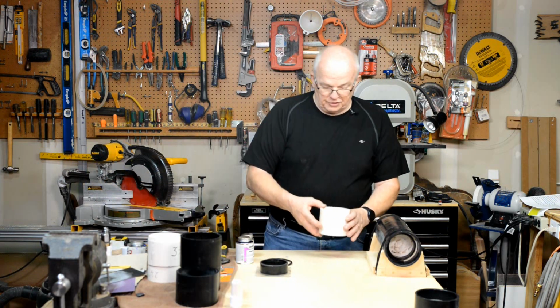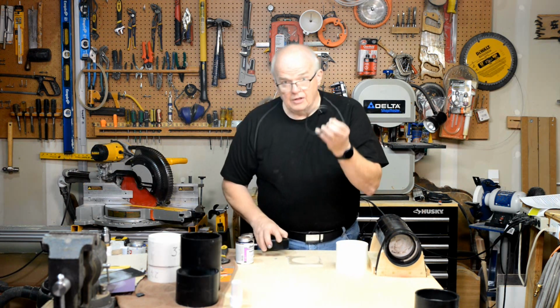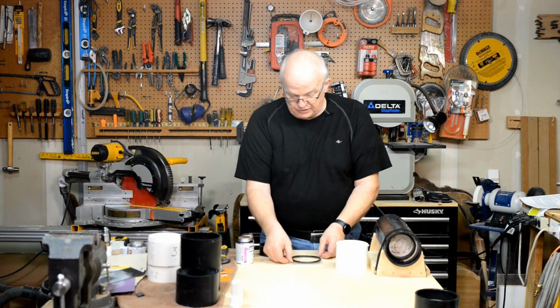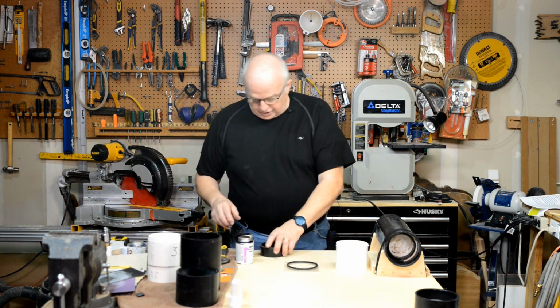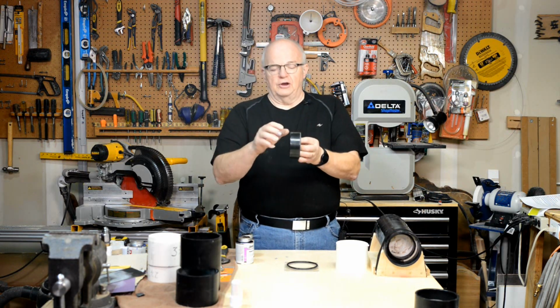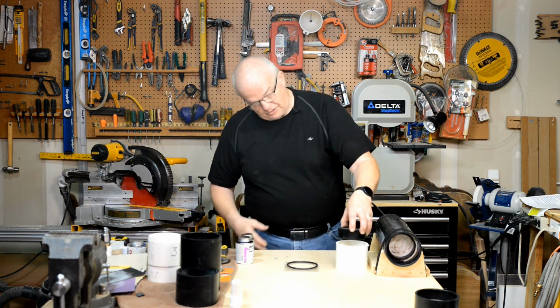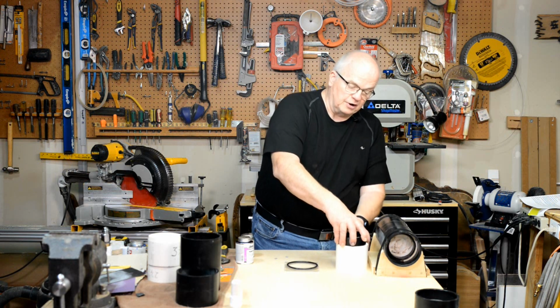So what we do first is we take this O-ring and we'll set it on top of this CD case cover right in the middle. And then we'll take and we'll prime this. Now, you can't see it here, but there's a slight bevel here which makes it so that this side is going to be easier to fit in there than this side.